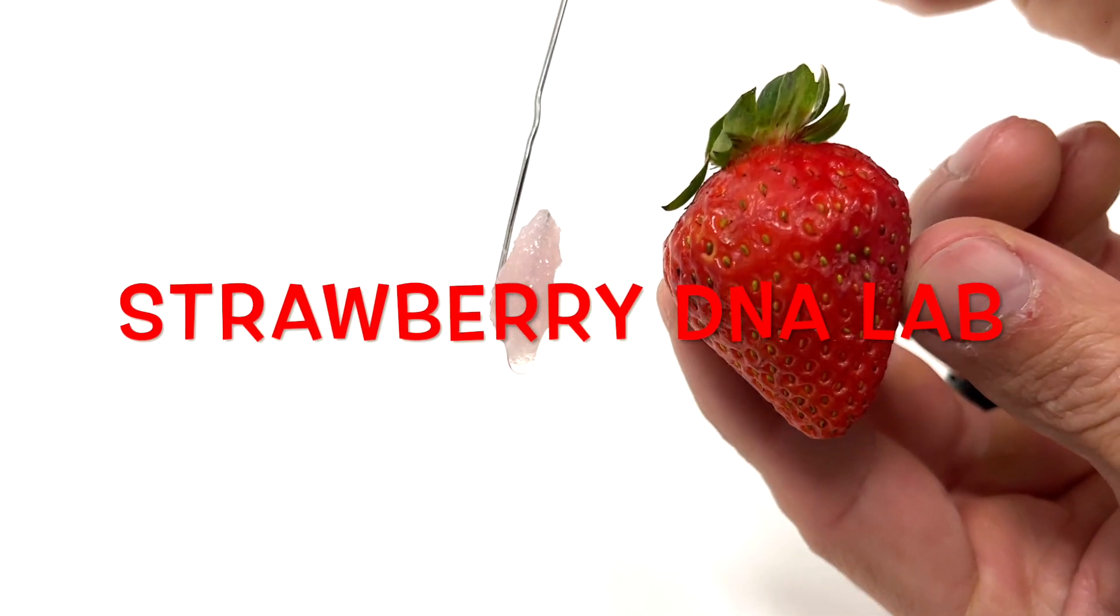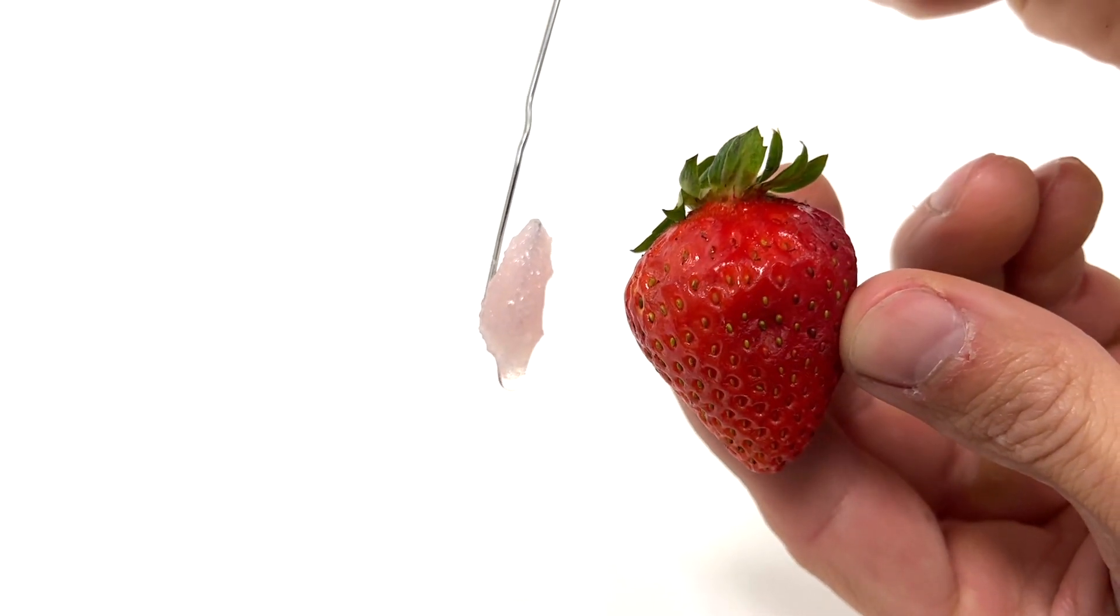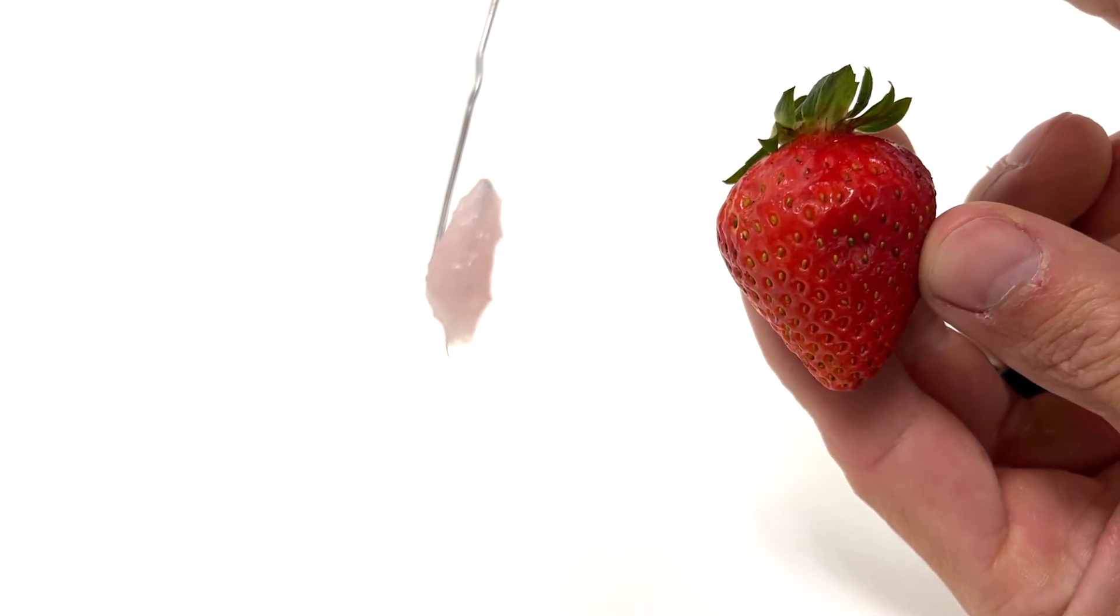This is the Strawberry DNA Lab where you get to extract the DNA from a strawberry. It's really fun and easy to do and pretty hard to mess this lab up.